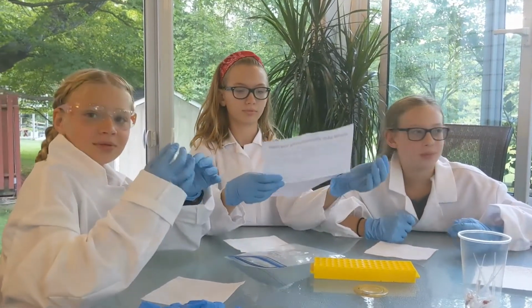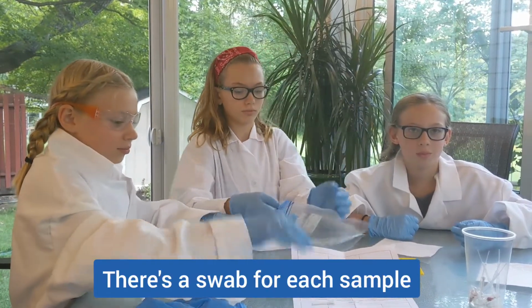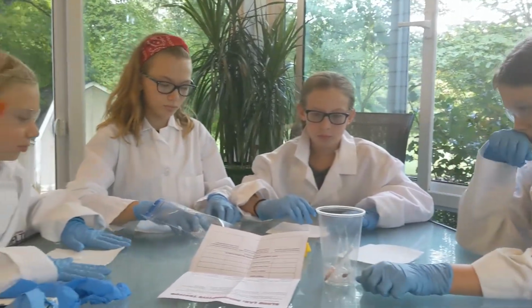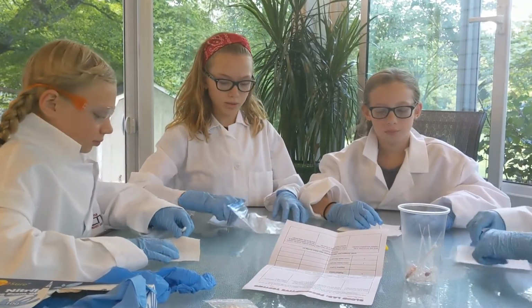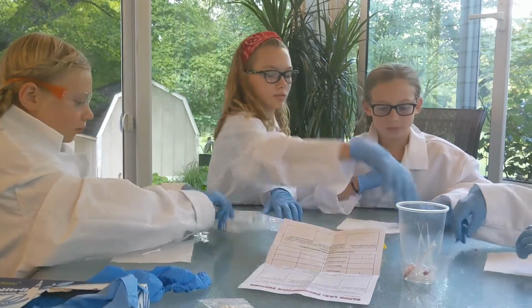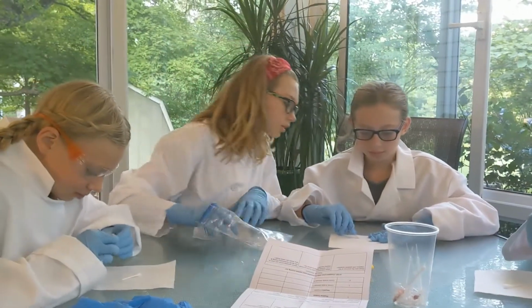Q-tips. Okay, so those are the swabs that you guys are going to use to pick up your samples. So why don't we give one of those to each of you? And what else? Blood. Okay, so give one of those to each of you. Now, it may be blood. It might not be.